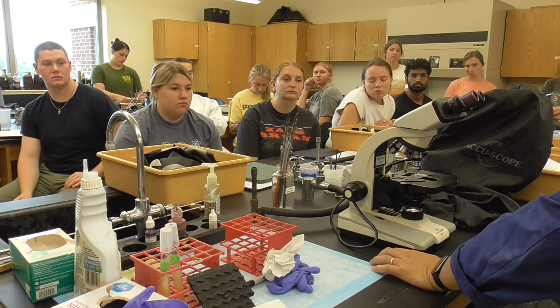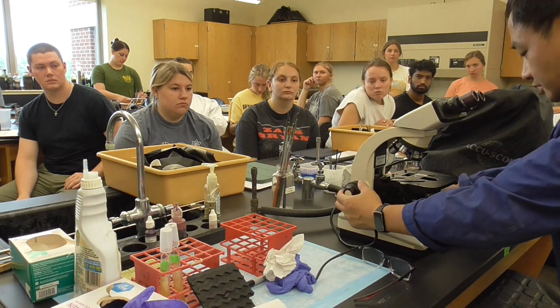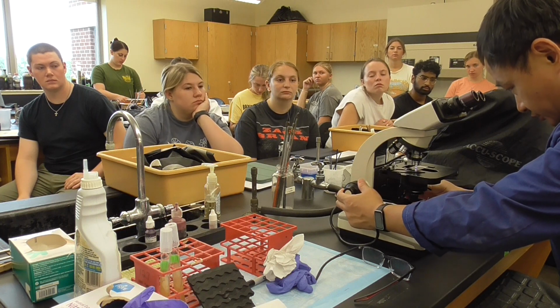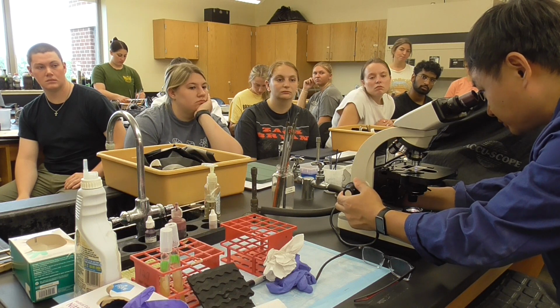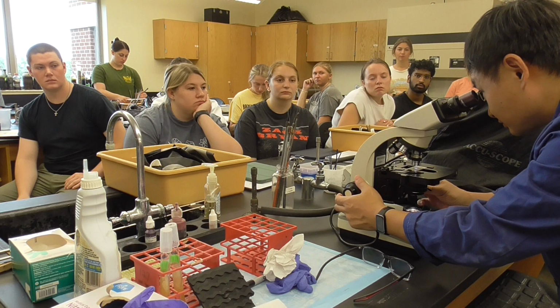I think its iris diaphragm needs to be at 10 to control the amount of the light. Okay, now let's do that. Okay, so it won't crush it, so you go down a little bit. Okay, you can see lots of them at 10x.